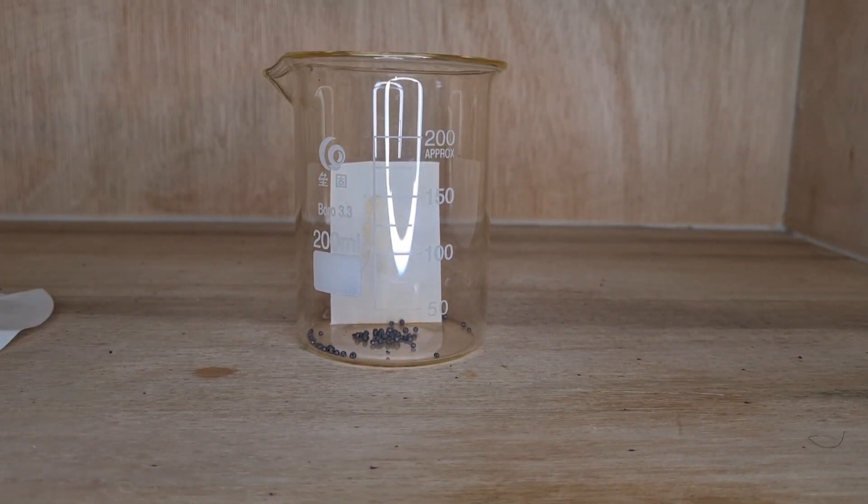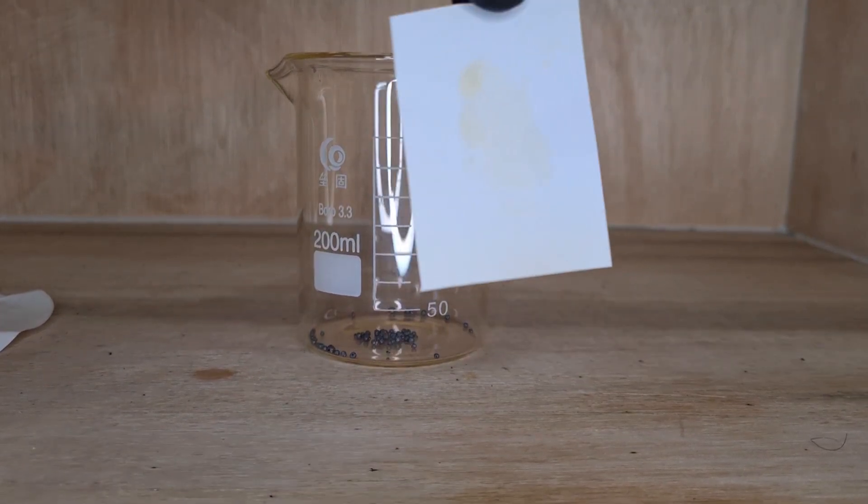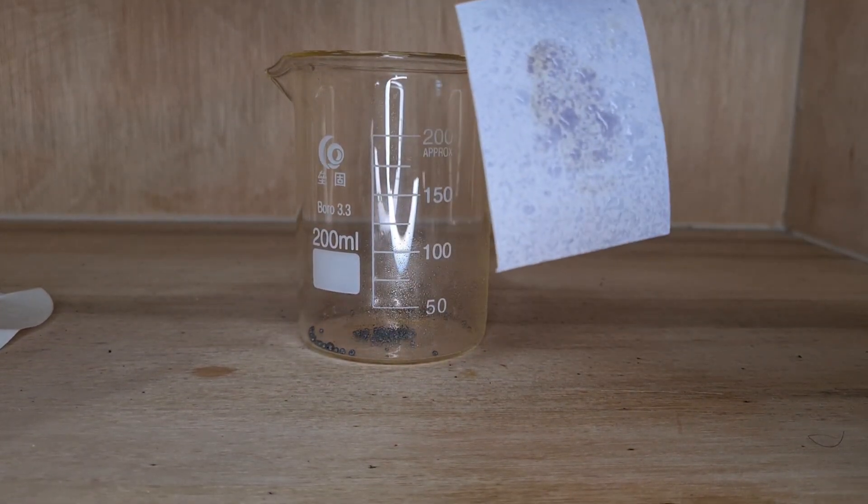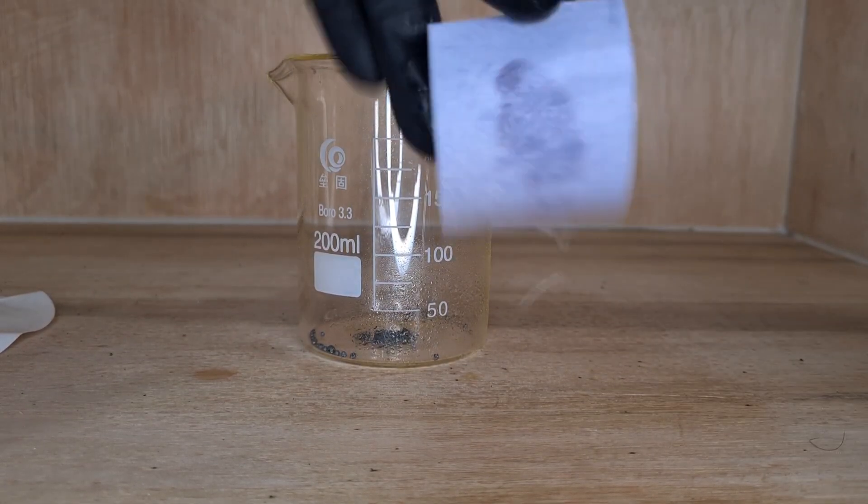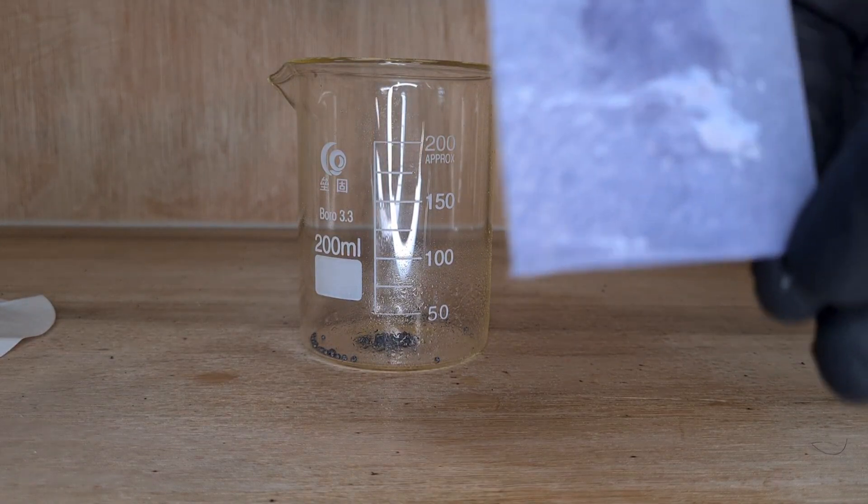Now I'm gonna pull it out of the beaker and you can kind of see the fingerprint. Now if I spray it with starch solution, you can see the fingerprint pretty well.